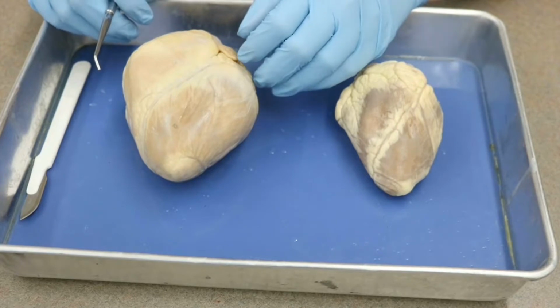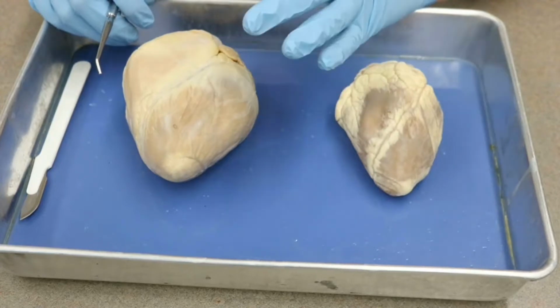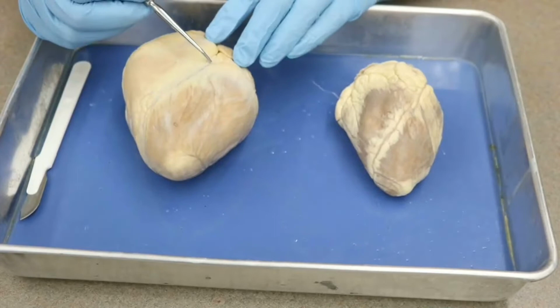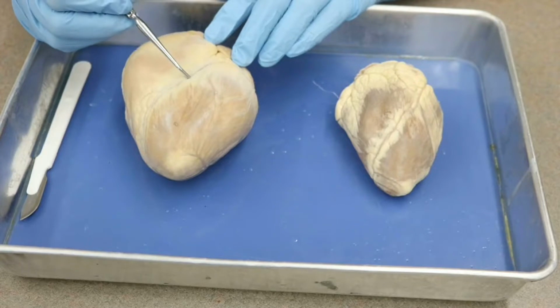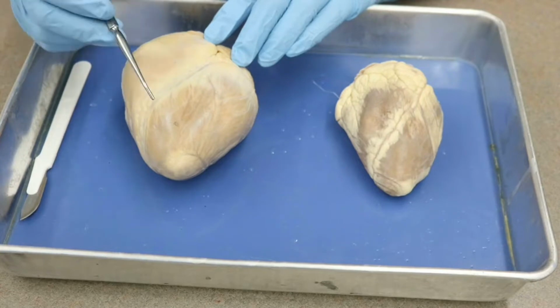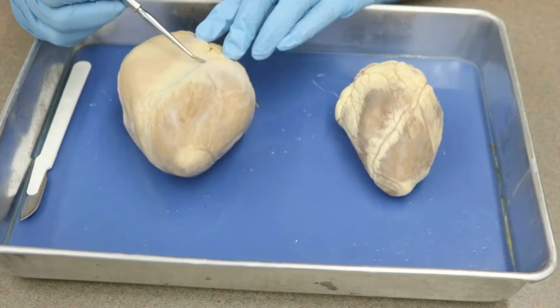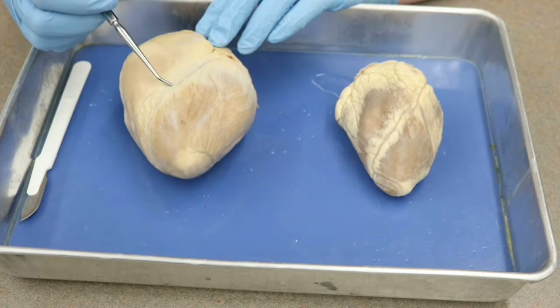So let's go with our sulcuses, or sulci. Just like in the brain, a sulcus is kind of the space. Remember, our gyri were the wrinkles, and the sulcus was the space between. So the space here where our blood vessels would run, our coronary vessels, this is the anterior interventricular sulcus. Now that makes a lot of sense. Inter is between, interventricular, in between the ventricles. So our left and right ventricles, this is kind of in between them, and it's a sulcus. It allows the blood vessels to run in them. We would have a number of blood vessels here.